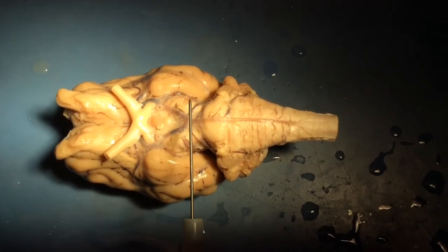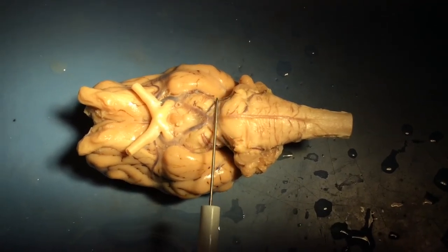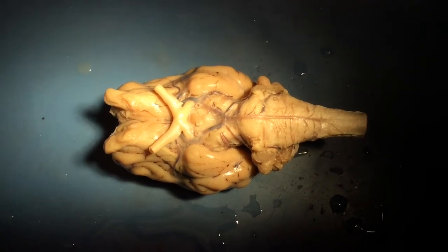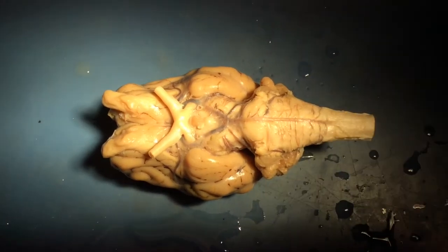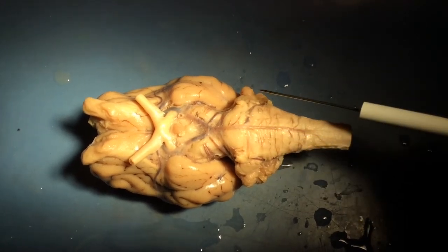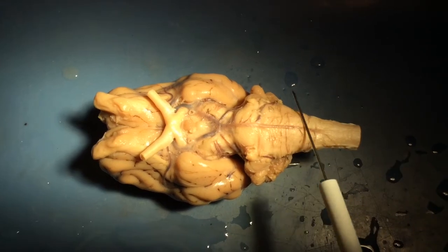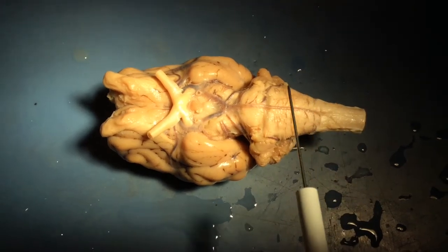Forebrain, midbrain, and hindbrain. As you move the probe back, you might not be able to see the three-dimensional structure here, but we actually reach a little bump, or a little hill, as we leave the midbrain and enter the hindbrain. And that bump is called the pons. The pons kind of resembles an Adam's apple on the neck of the brain, if you will. You can see a little bit of the lateral hemispheres of the cerebellum, because we're now back in the hindbrain, and the cerebellum sits on top of the pons. The structure behind the pons, this large structure, is the medulla oblongata. And then, if you lightly bring your probe back, it'll settle into another groove, and that's more or less the beginning of the spinal cord.